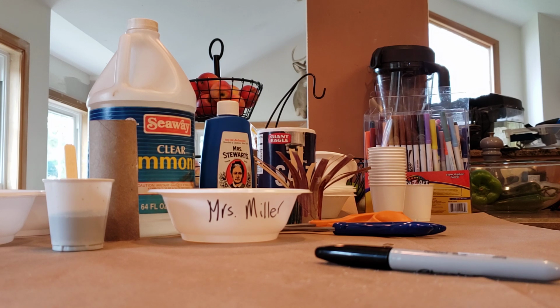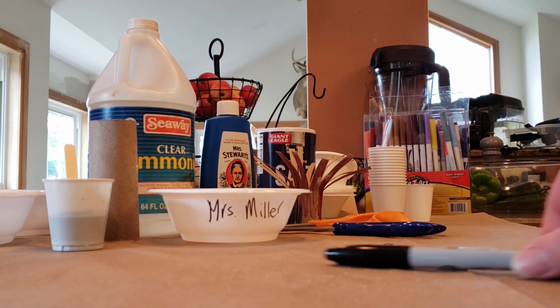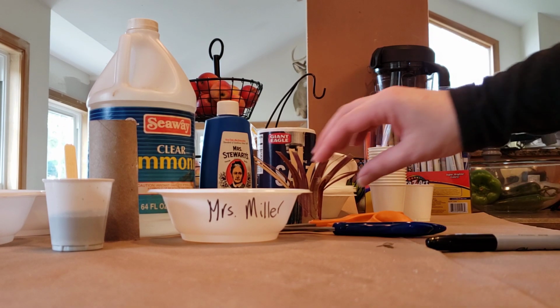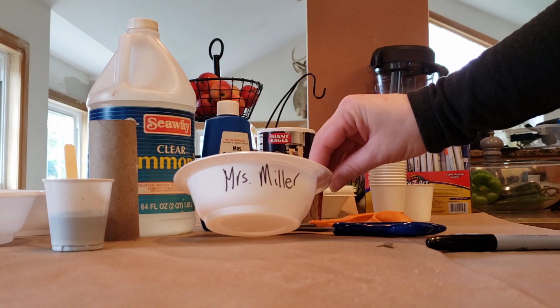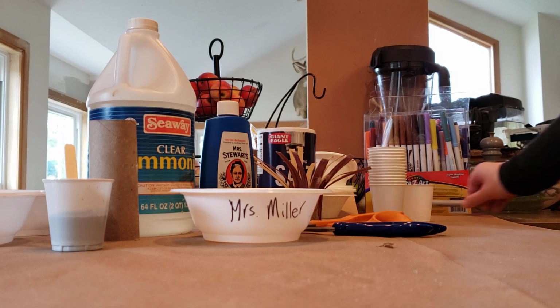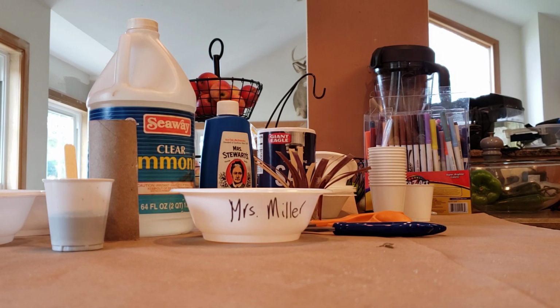So what you're going to do is get your materials needed, which I've all gathered for you to look at. You're going to get a Sharpie, which I've already done, and write your name and your class period on the side of the bowl. So here's the side of the bowl. I put my name on it, and then we'll put the Sharpie to the side. You want to put it on the side of the bowl because you are going to be creating something in the bowl and you don't want to have to lift up and look underneath to find your work.